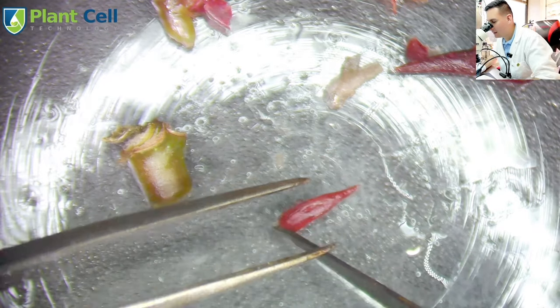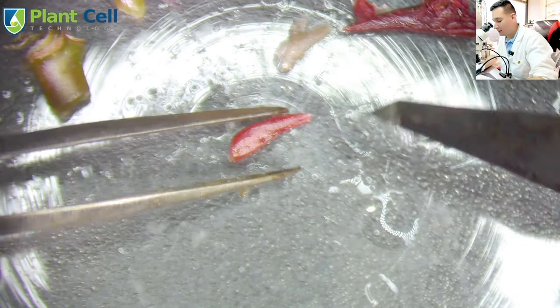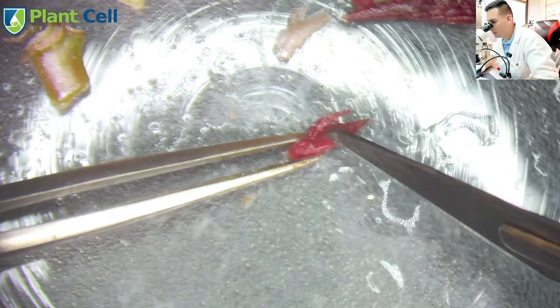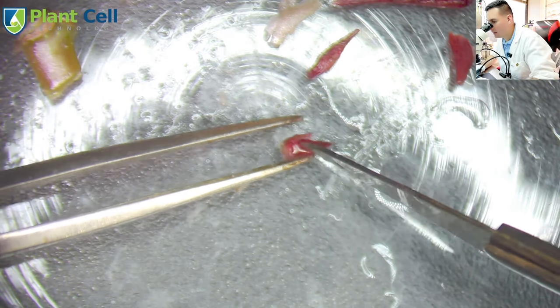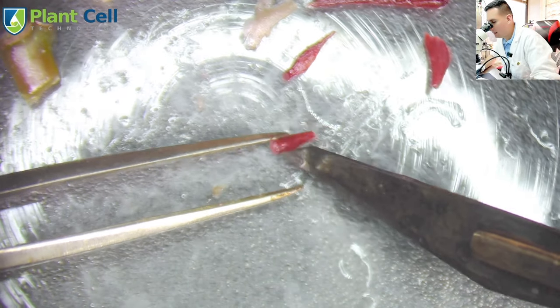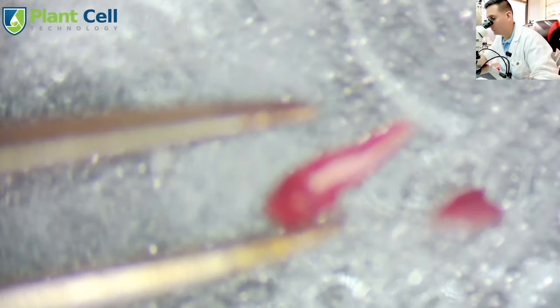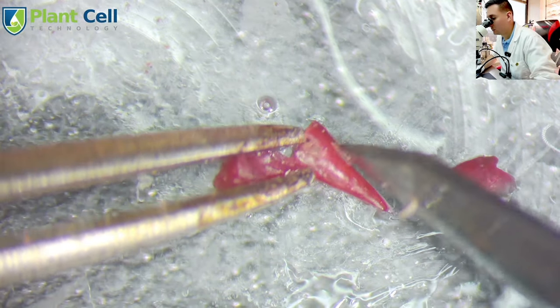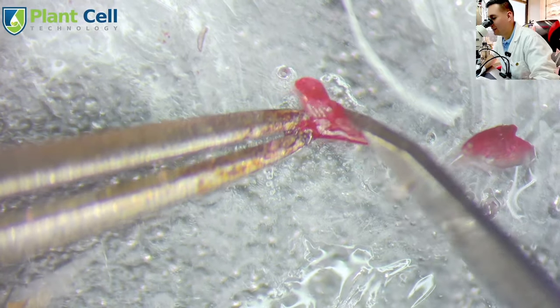Here's a video of Francisco demonstrating meristem culture on the apical meristem from the shoot tip of a large cane begonia. I've sped up this footage and cut it up, but the full video is about five minutes long since this is a bit of a tedious procedure. You can see that he's slowly peeling away the layers of the shoot tip, and at the end of this clip, once all those layers have been peeled back, it will ultimately reveal the apical meristem inside.